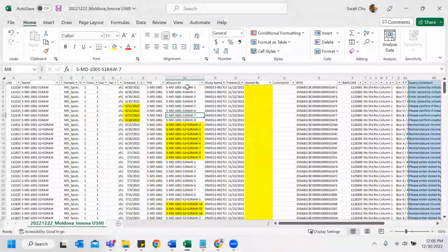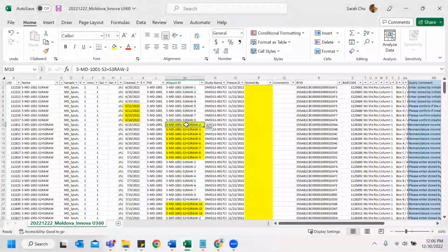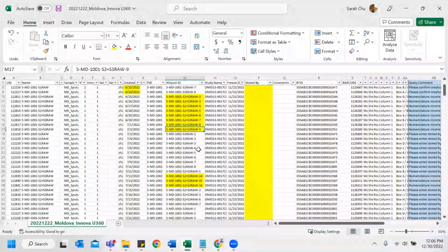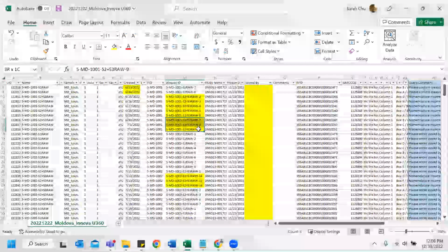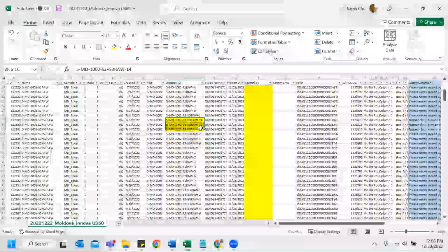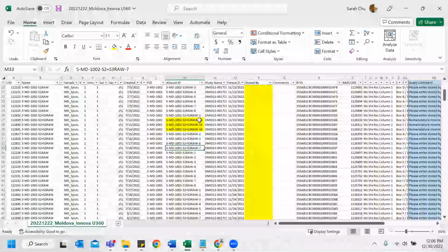Name is fine, but you can see here that it's 1 to 8, but then the second one, S2 plus S3 raw, starts with 2 and then goes to 9. If you keep scrolling down, it's usually 1 to 8, so I highlight it to make sure whether this is an issue or not. And the next one here, 1, and there's 14, 15, 16, which is not sequential. And by looking at this, it might be a typo. 1, 2, 3, this would have been 4, 5, 6, 7, something like that.